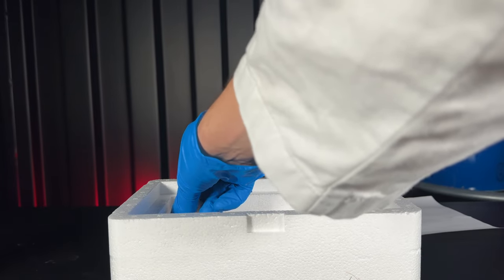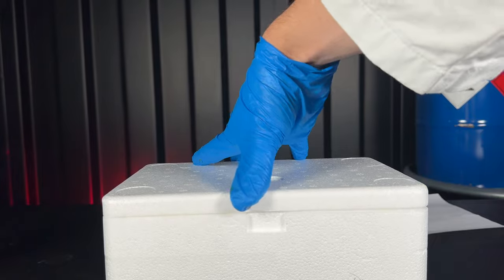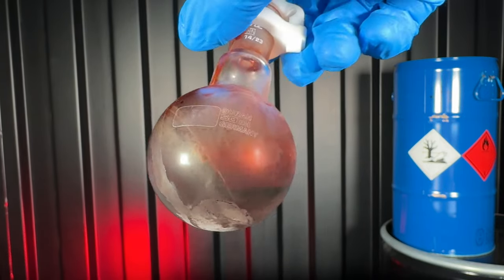To isolate the product, I put the flask into a box filled with ice. Three hours later, as it cooled down, the red magic powder crashed out.